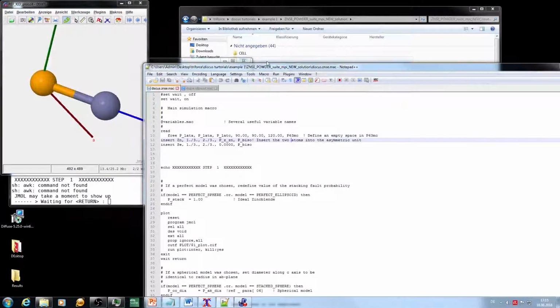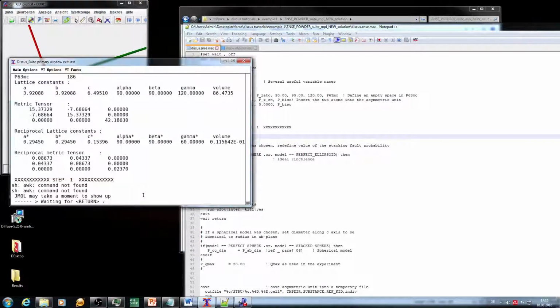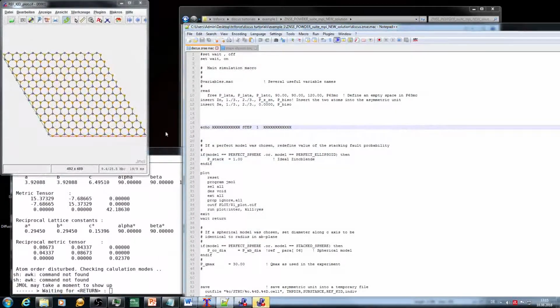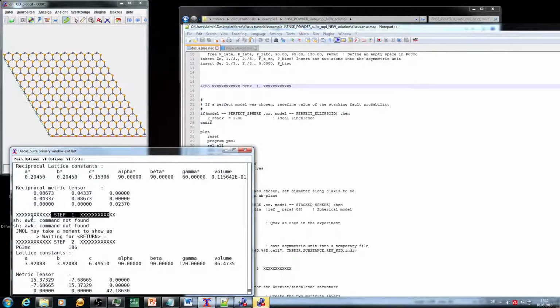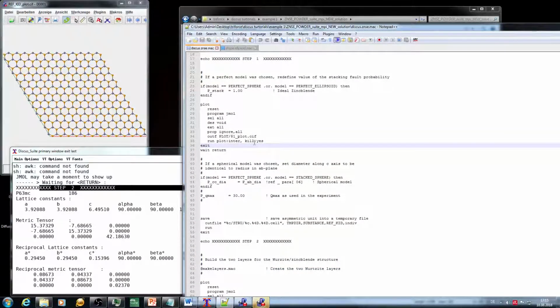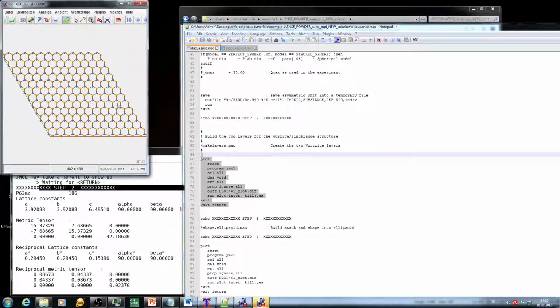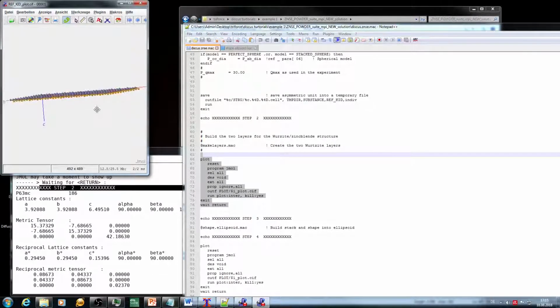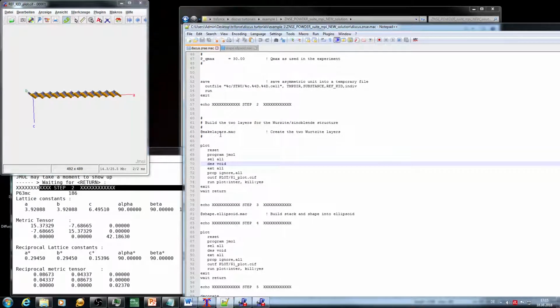We can just go through the macro for the moment. So it pretty much reads a structure, which is the zinc selenide structure. It's a hexagonal structure, and pretty much has 2 atoms in there. So that was the first plot, and you can also see that step 1 was done, and here was the plotting macro. We reached step 2 here, and we reached this plotting block now, which is after the make layers. So we have now created a layer out of zinc selenide, and this goes on in general. After each bigger block I normally plot the structure and put an echo in there.